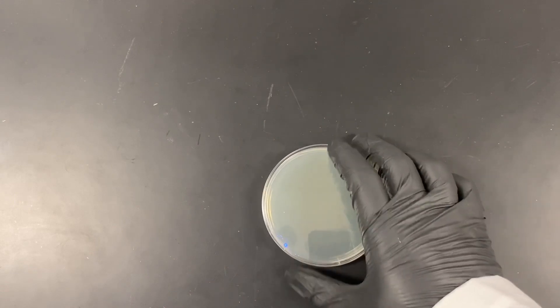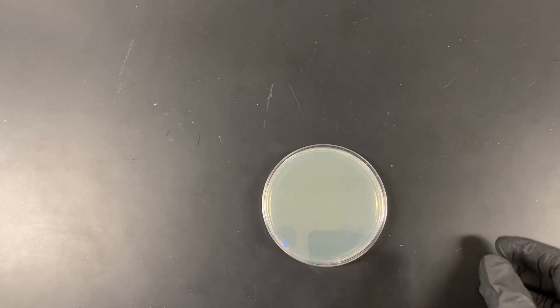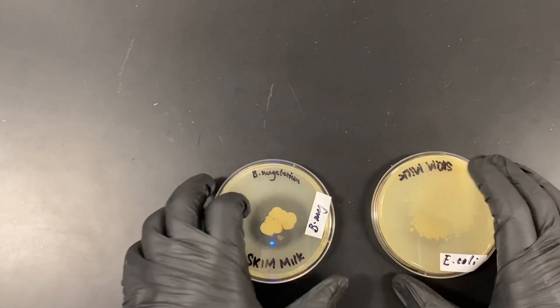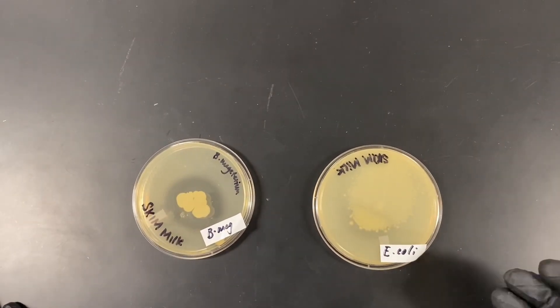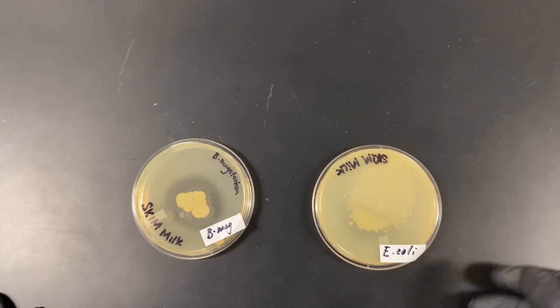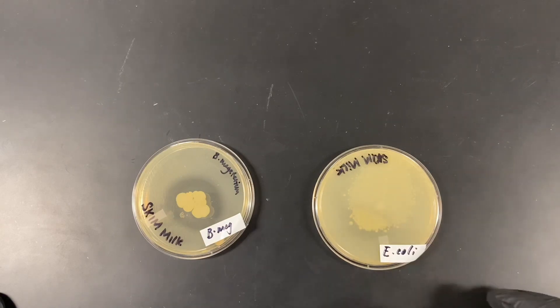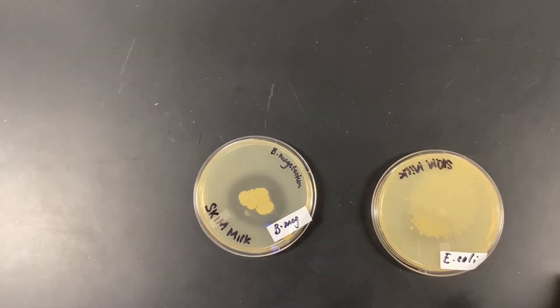For laboratory 20, we use a milk agar plate enriched with milk, which contains the protein casein that can be used as a source of energy. When we inoculate plates, we look for whether the organism can produce the enzyme caseinase and export it outside the cell as an extracellular enzyme. If it can, it will break down the milk in the agar and produce a zone of clearance. If it doesn't have the enzyme, the casein remains opaque and solid. Your job is to determine how this is done.